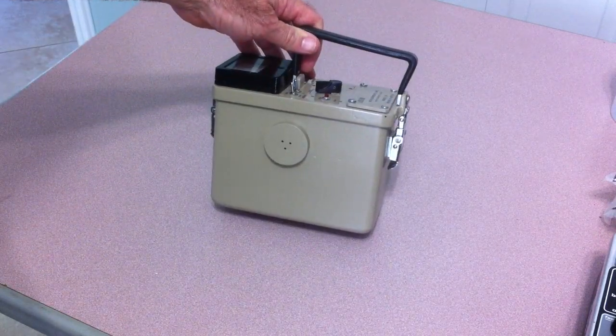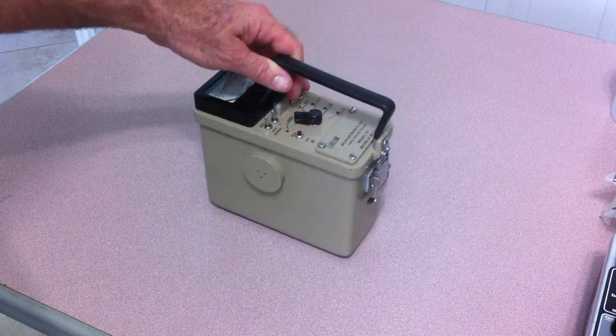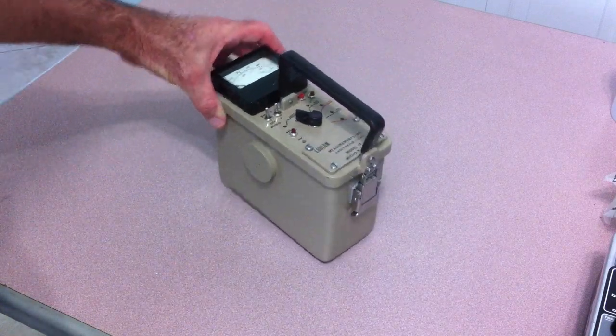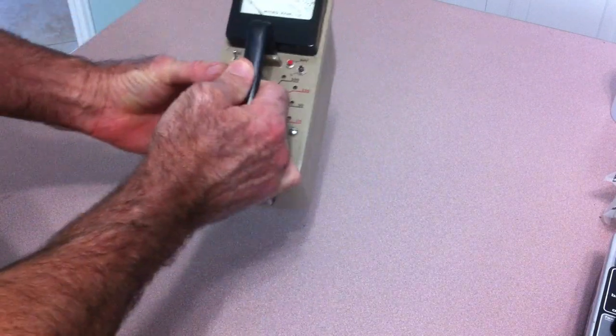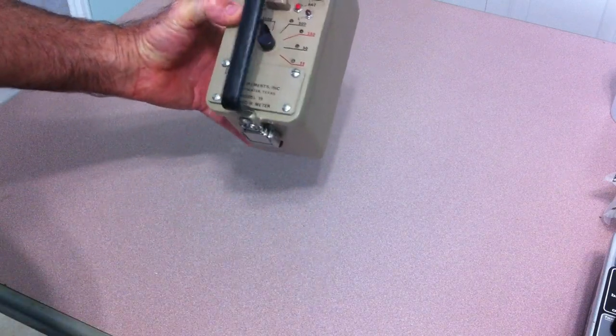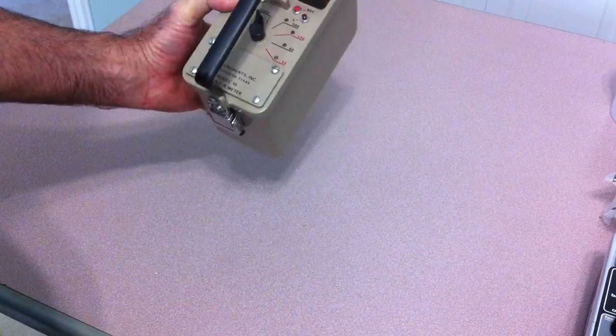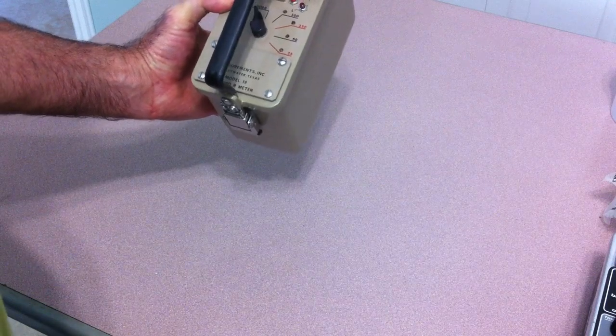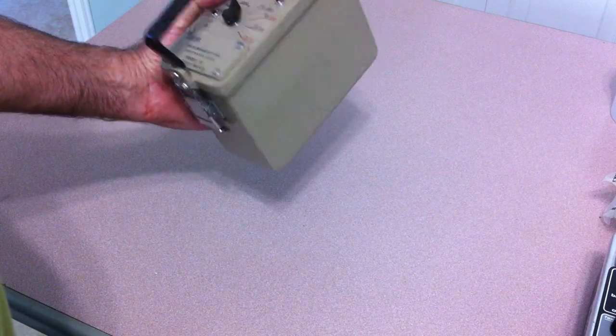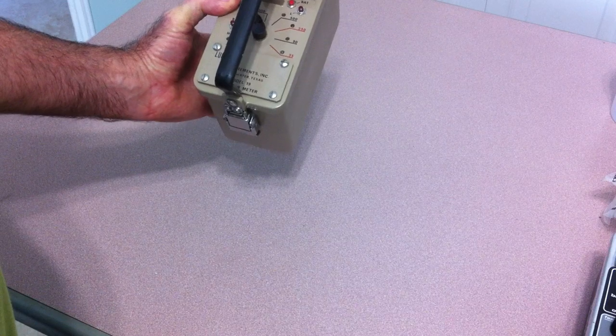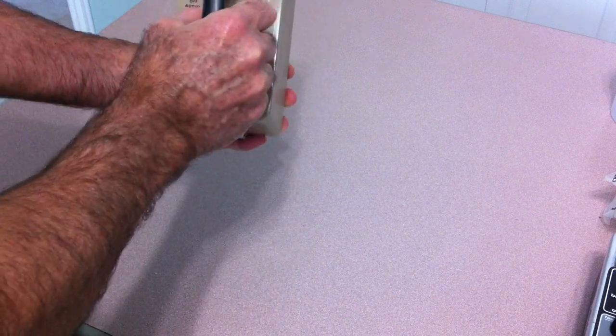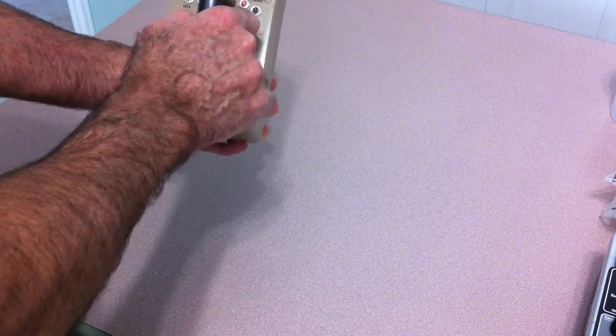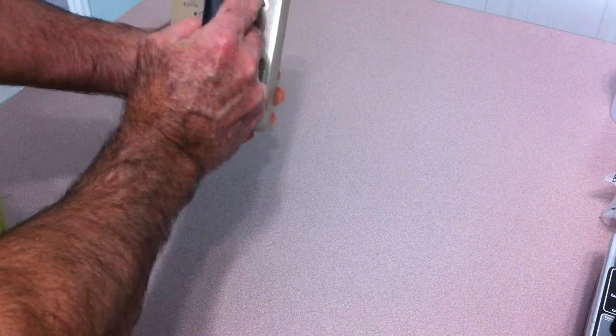In other words, we don't have any further worries with this thing needing a crystal replacement as the moisture and other environmental factors should not be a factor in causing any future problems with that crystal. This unit now is fully functional and fully refurbished with all the functions working on it.